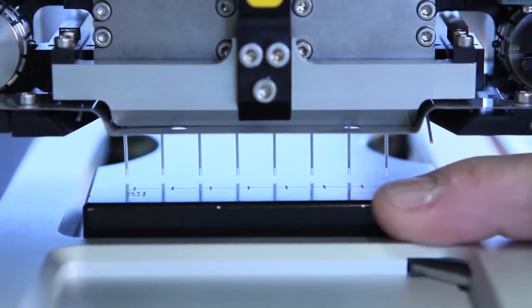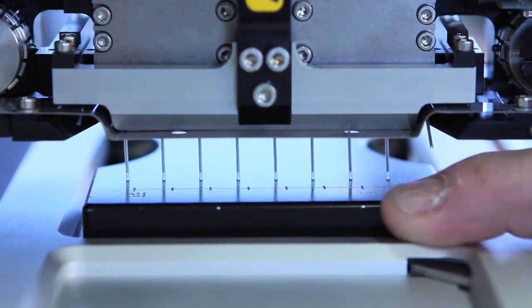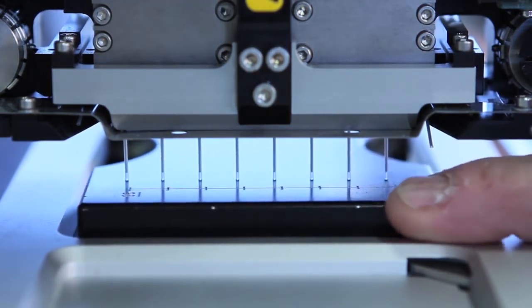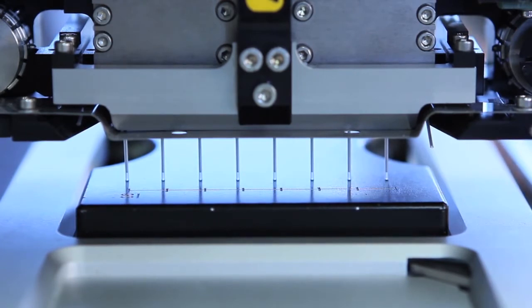And one tip here is if you move the block, you will just see the tip start to move. Click next.